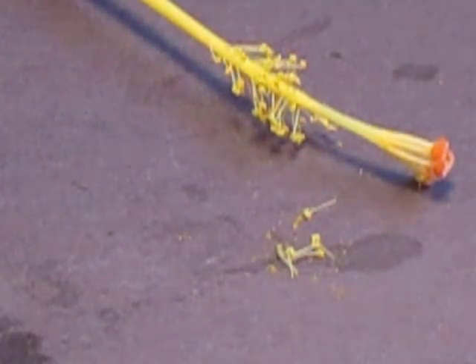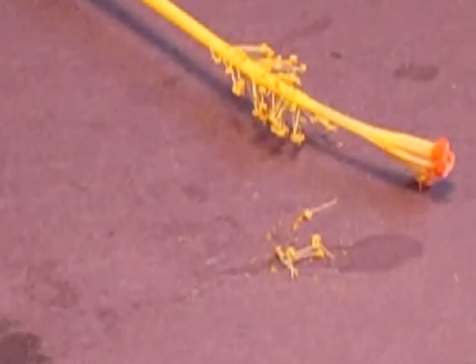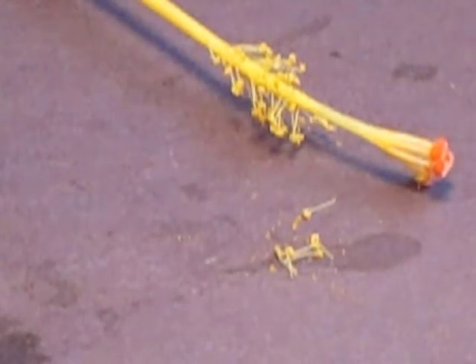I would try to zoom in on it, but the zoom is not very good. So I have another picture that I took when I did a practice run of this. So there's an up close version. You see the little stem. Okay, the little stem, that is your filament, and the anther is the part that's on top of the stem. That's the part that holds the pollen. So that's what it looks like up close. Okay, so that's the male part of the flower. That's the stamen.